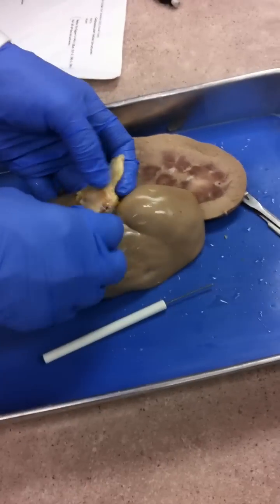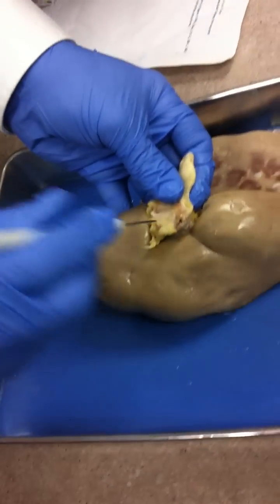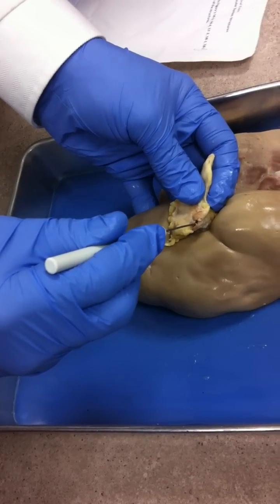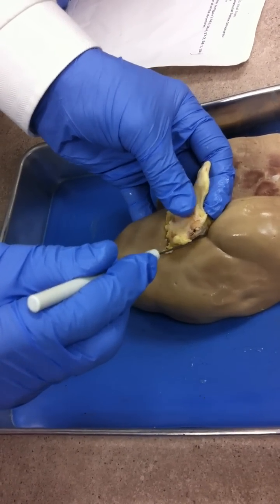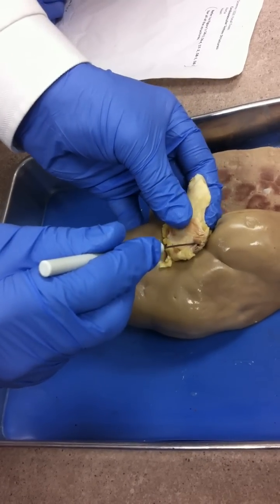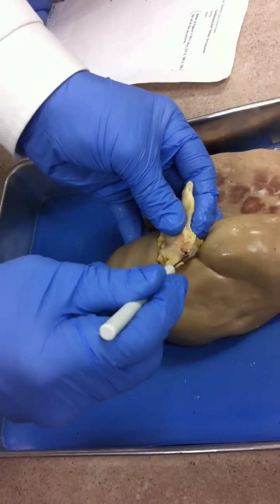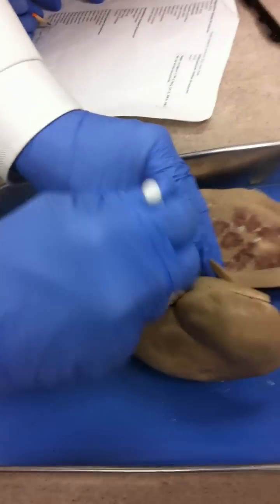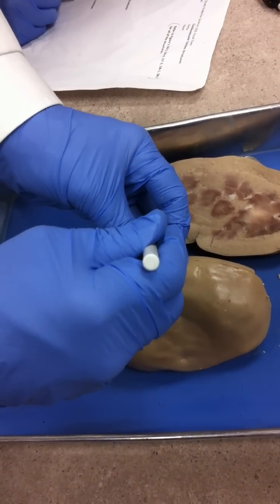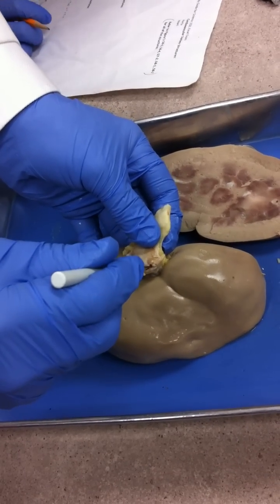You'll see two pins that are adjacent to one another. You have a hole here and a hole here. In a renal vein, veins typically have a bigger lumen. A lumen is an opening in a structure. You can tell which hole is bigger — this one is bigger than this one. So when you see the two pins adjacent to one another, the one with the bigger lumen is the renal vein, and the other is the renal artery. The one with the biggest hole out of all three is where the filtrate goes from the kidney to the bladder — that's the ureter itself.